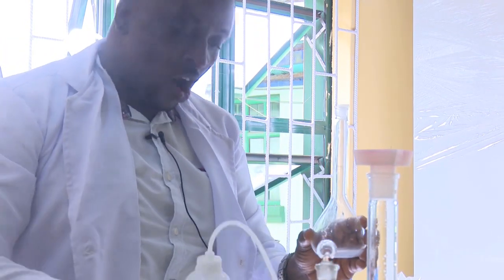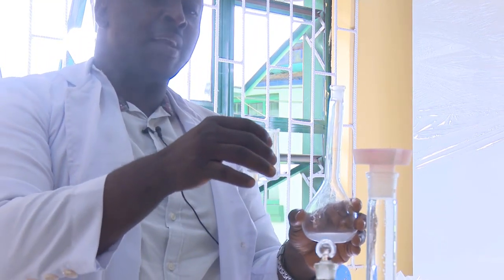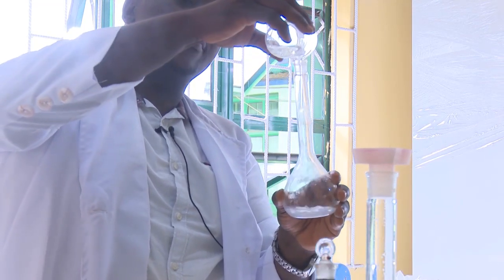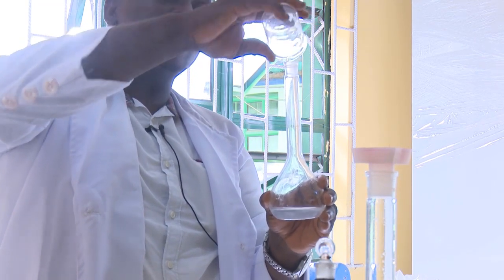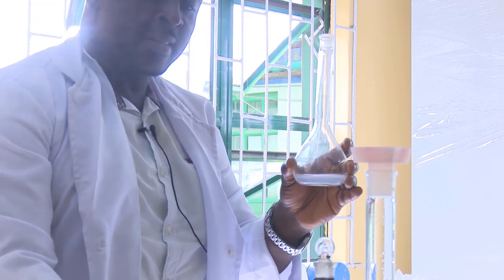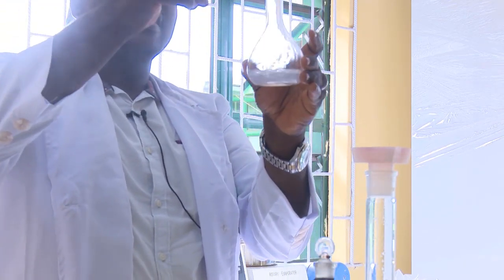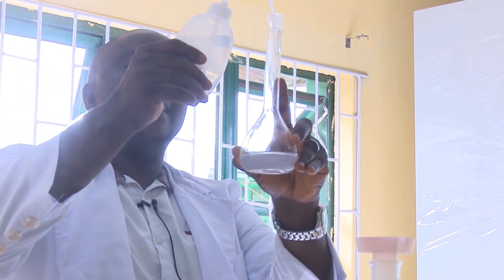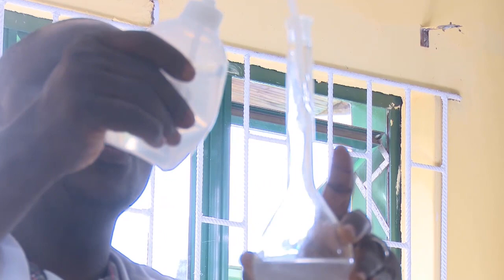Now we are going to make this up after rinsing the beaker repeatedly to ensure that every part of the chemical I mixed earlier is taken out, and pour it into the standard volumetric flask so that we can have the exact concentration calculated from what we predetermined. Yes, we want to prepare 1 molar. So having done that, now I take my wash bottle containing the distilled water and make it up to the mark. If you look at this standard volumetric flask, there's a ring, a dark brown line around the neck, showing that this is where we are to stop.